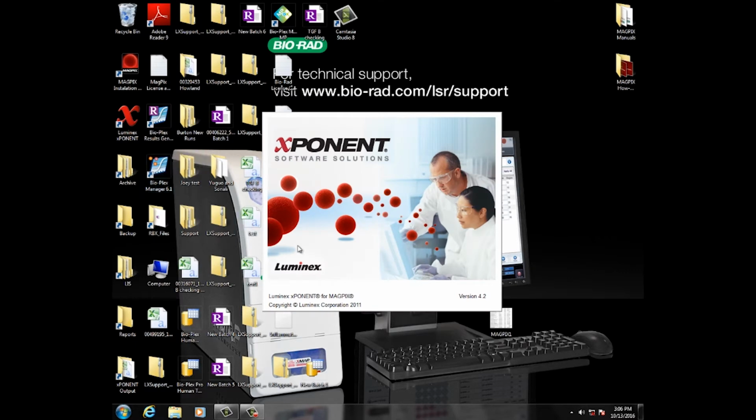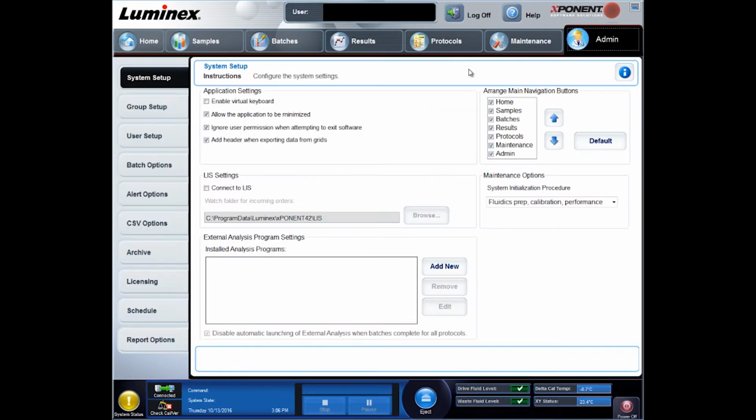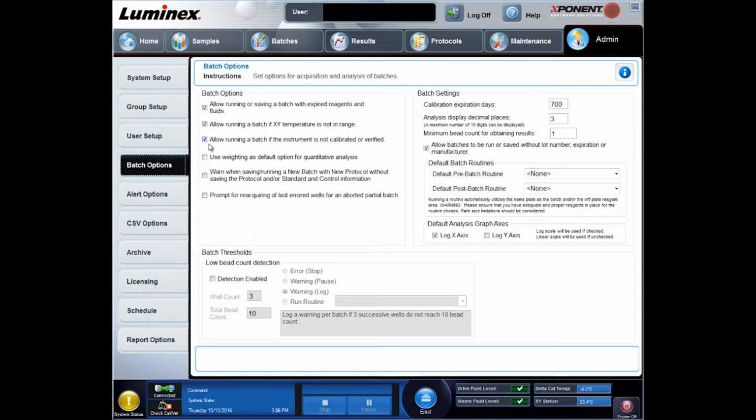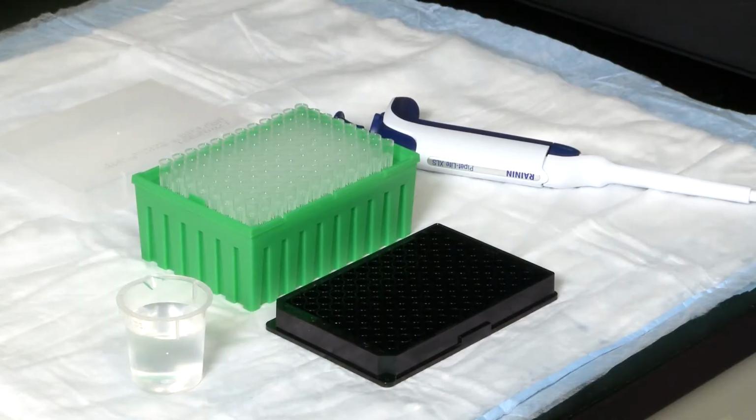Launch the xPONENT software. Under the Admin tab, select the Batch Option tab. Under Batch Options, select the box next to the Allow running a batch if the instrument is not calibrated or verified option. This will prevent errors while running the DI water test. Make sure you log off the xPONENT software. Now you are ready to do the DI water test.